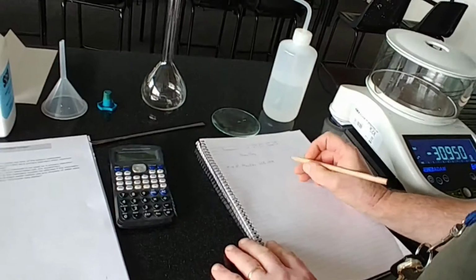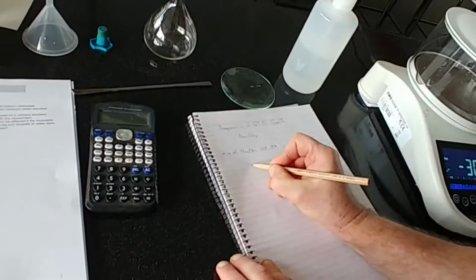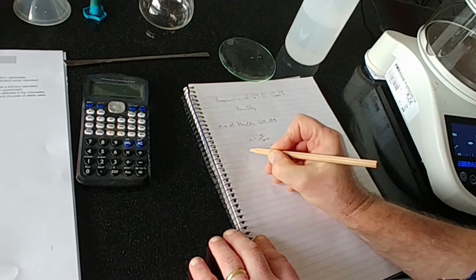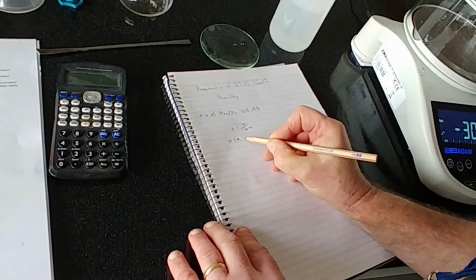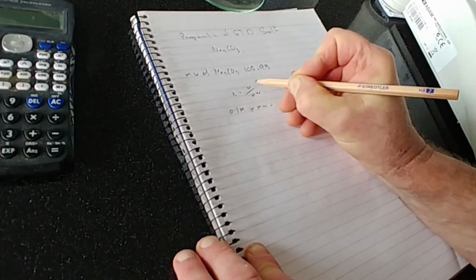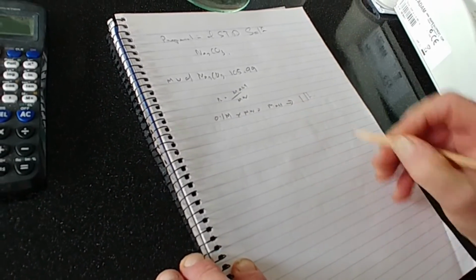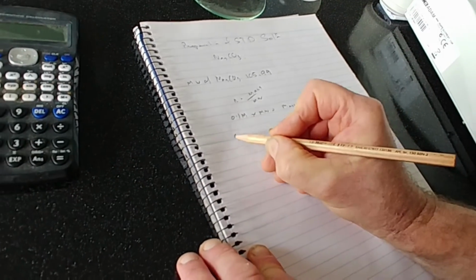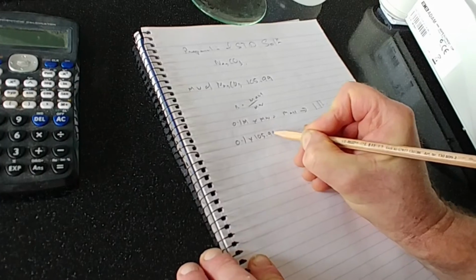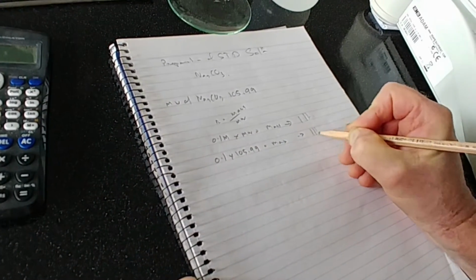Now, to produce a 0.1 molar solution, we use the formula number of moles equals mass over the molecular weight. We want 0.1 molar solution multiplied by the molecular weight gives us the mass that we need to put into 1 litre of water or distilled water. So it's 0.1 multiplied by the molecular weight, which is 105.99, equals the mass in 1 litre.